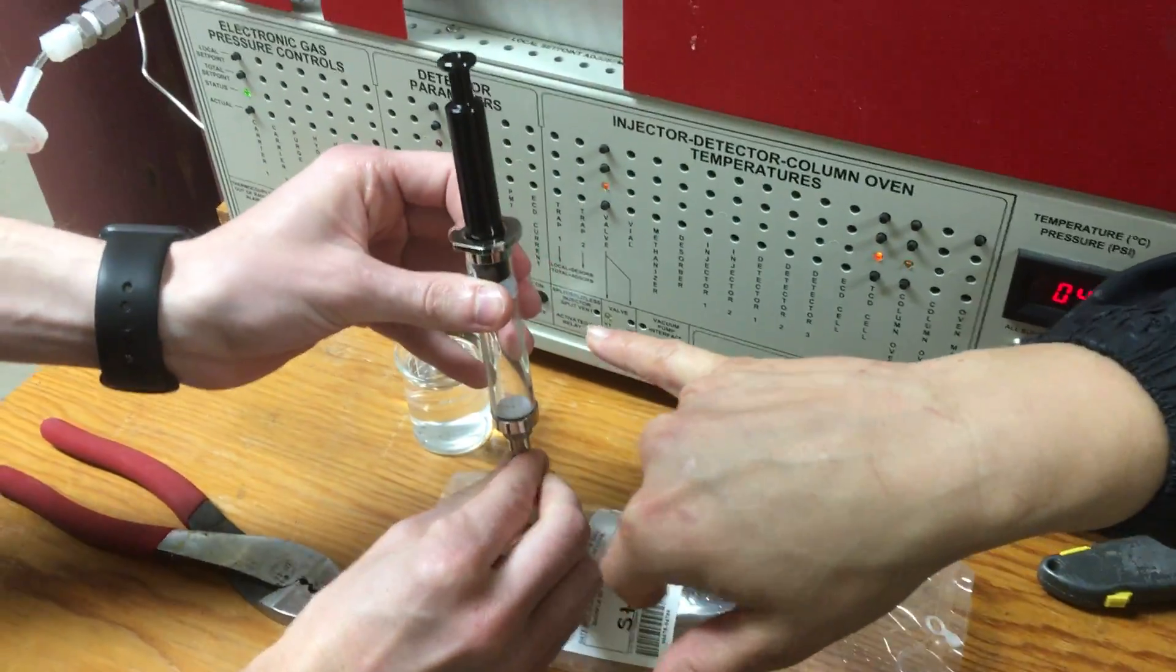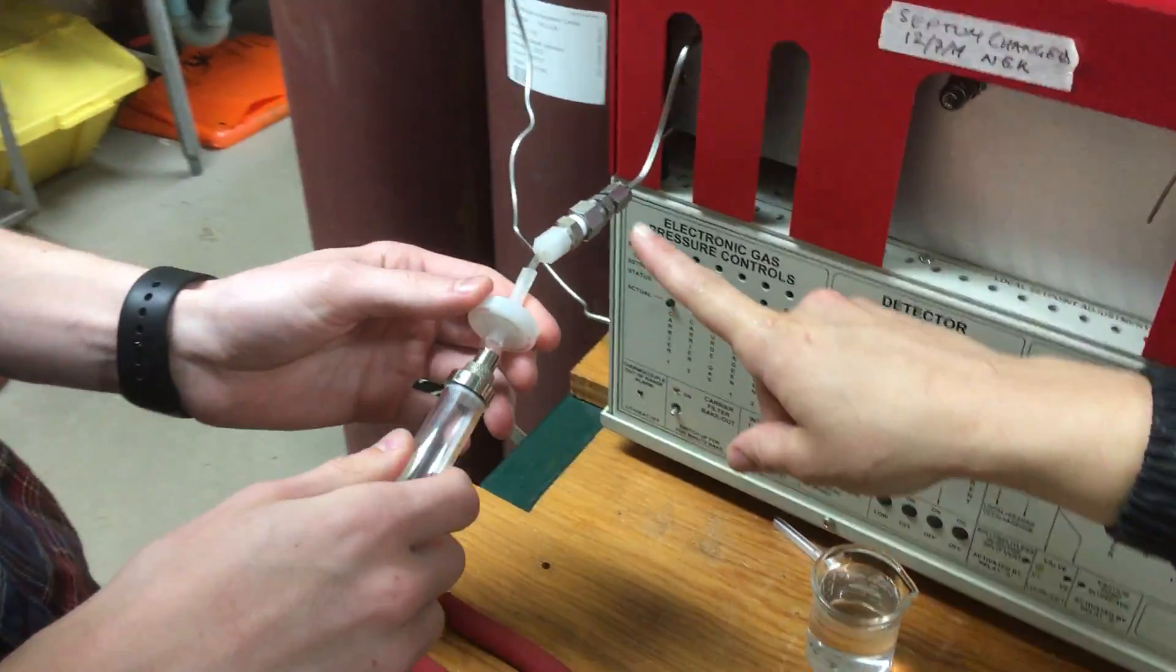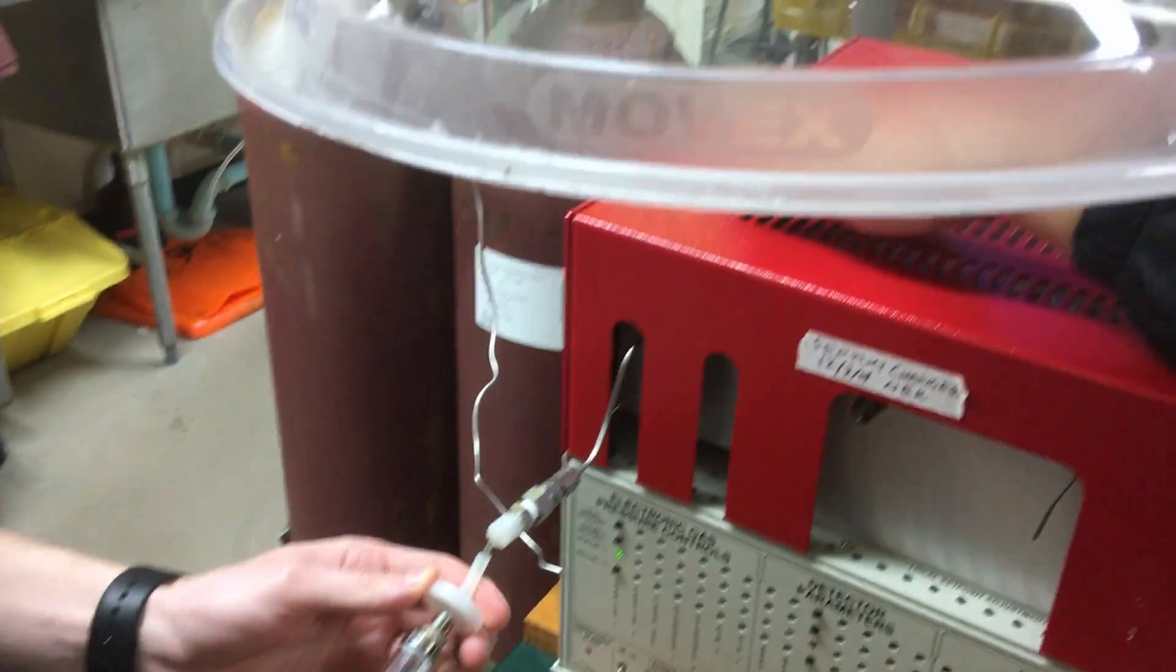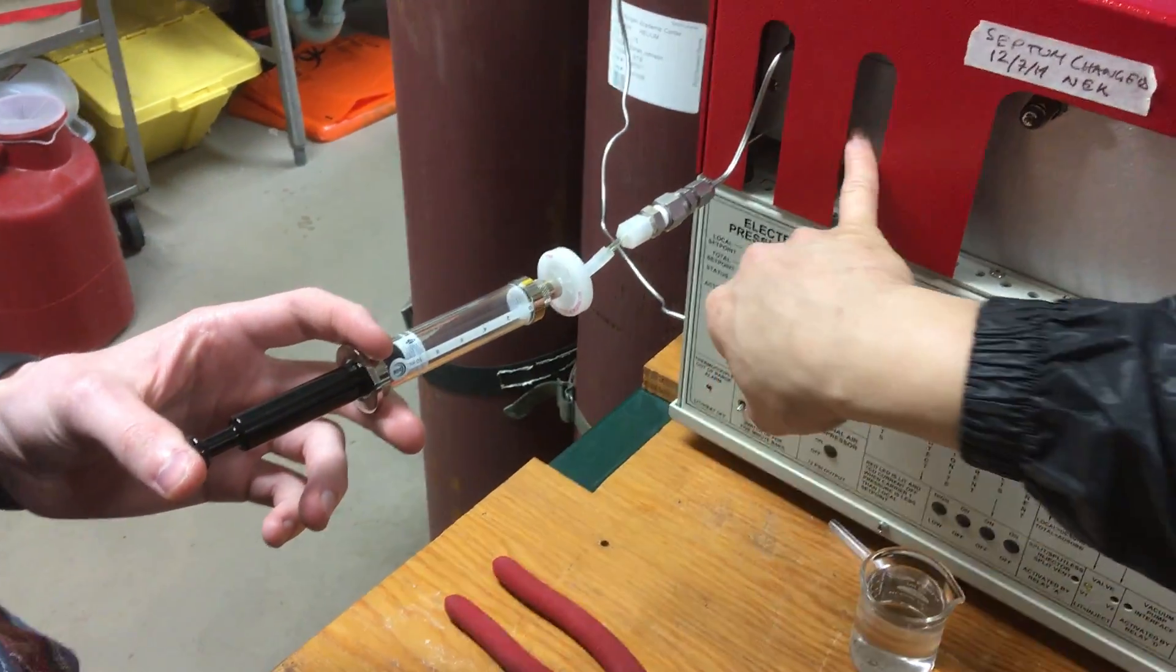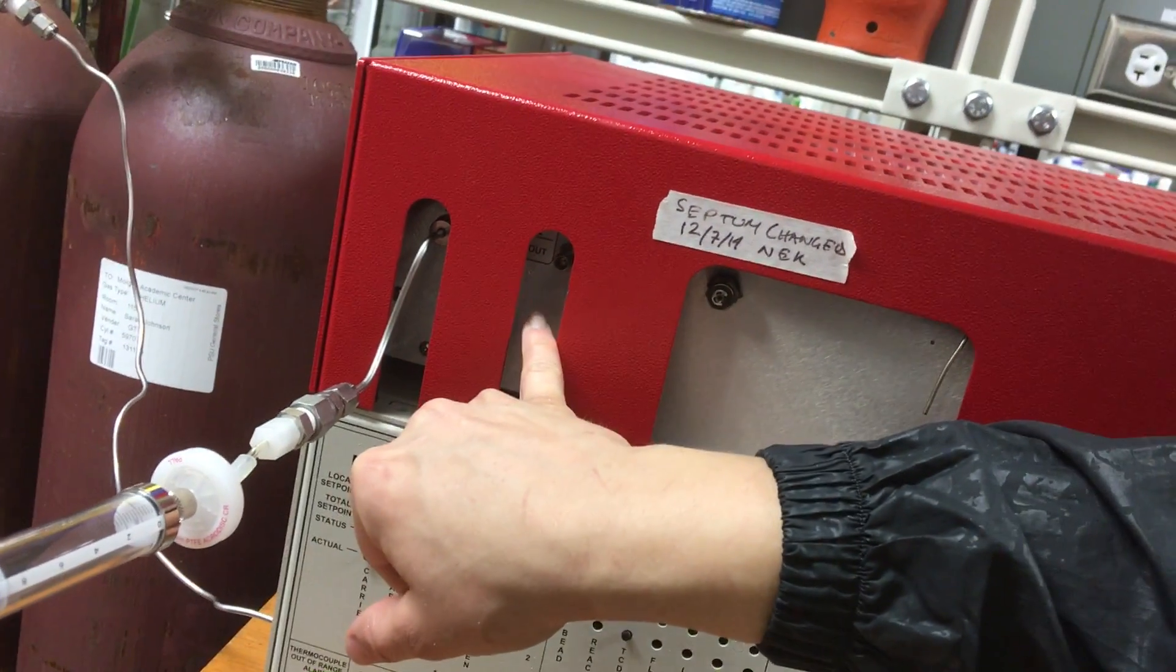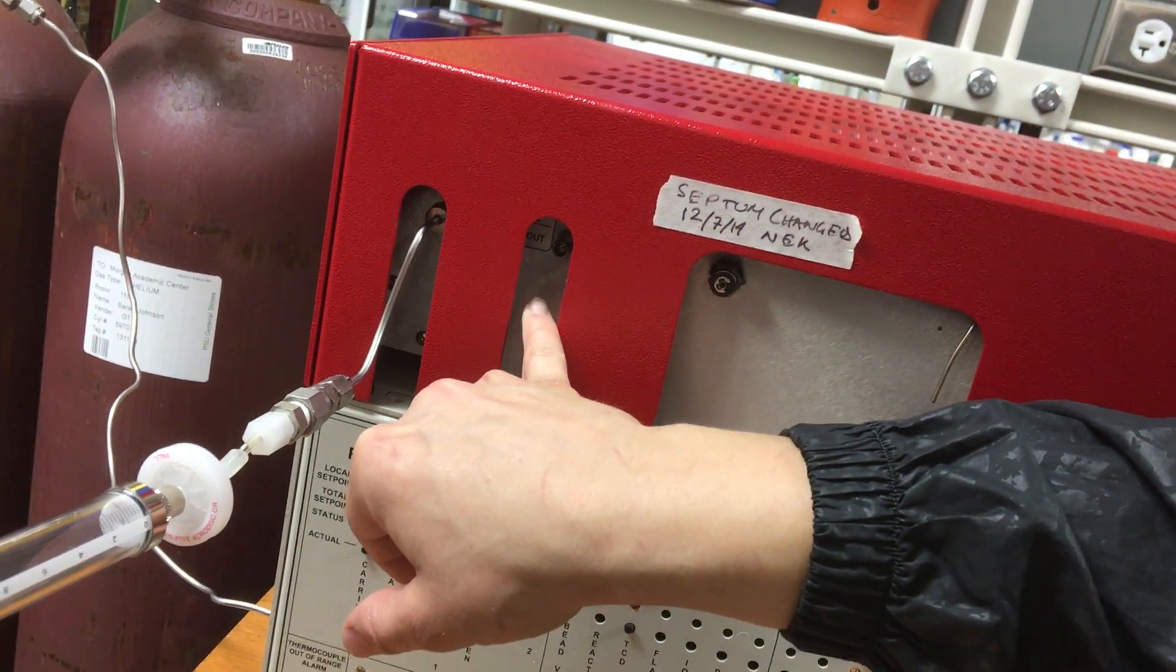This is a 10 milliliter syringe. This sample tube that he's injecting is a 1 milliliter, and so any excess of 1 milliliter will come out of this right here. You can even hear it coming out when you do it very quickly.